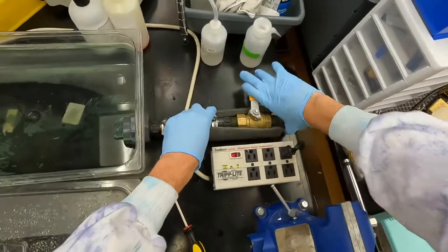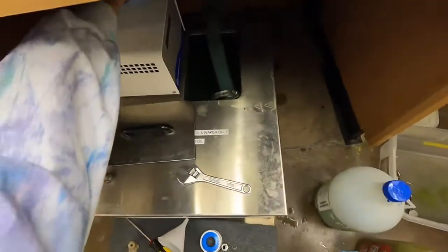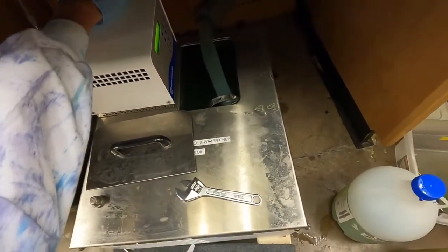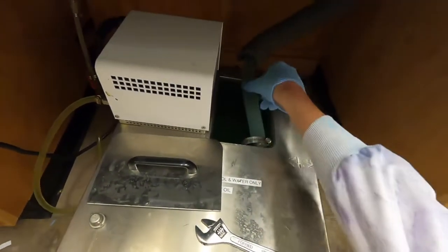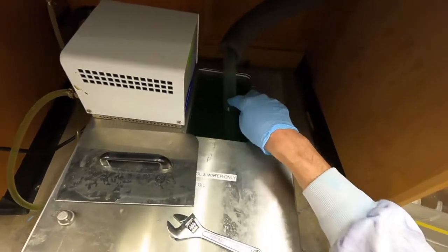Then you flip this on - just a little power switch in the back. You'll feel it. As you turn this on, you'll start seeing this water down in here start to lower.